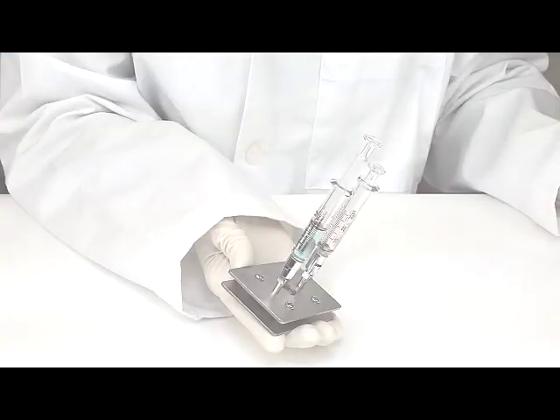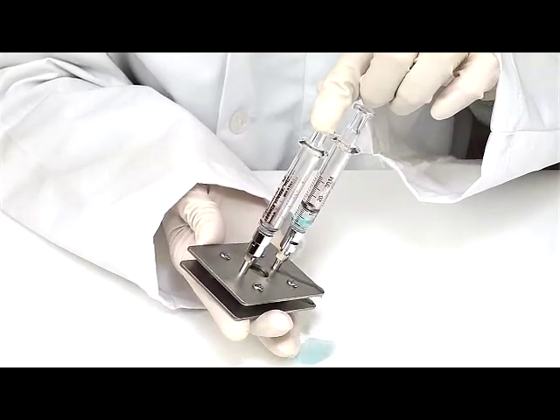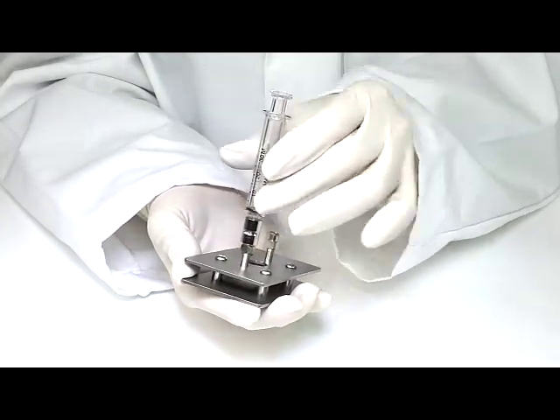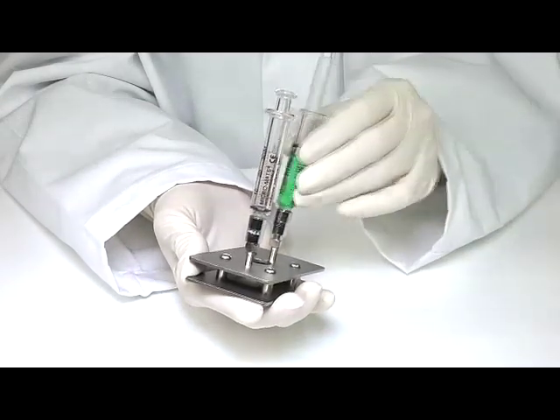Improper filling techniques, such as forcing the fluid into the cell by pushing a syringe with the sample, often result in the cell leaking. Correct filling is done by connecting two syringes onto the luer lock fittings. One syringe contains your sample and the other syringe is empty.